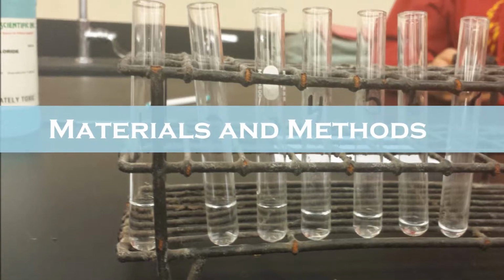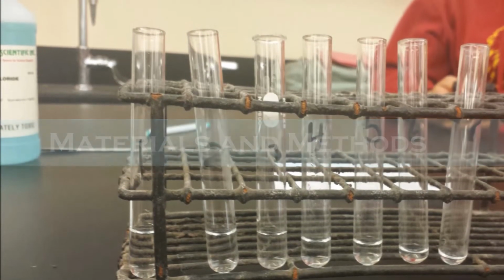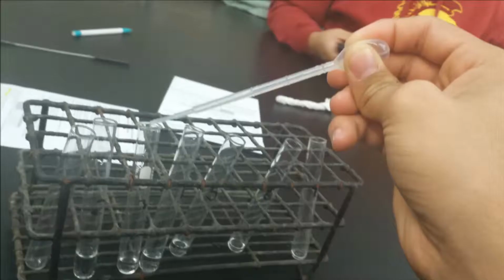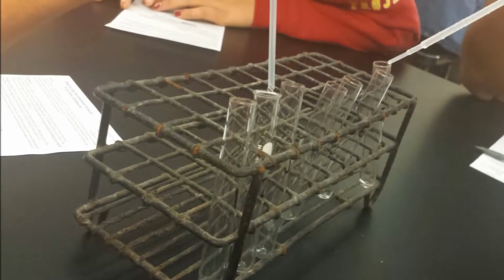To perform the lab, we use 7 test tubes on a test rack, 2 solutions, Na3PO4 and CuCl2, a pipette, a data table from the lab worksheet, and a stirring rod. Each test tube was numbered 1 through 7 and placed in a test tube rack. The pipette was filled with copper-2 chloride solution, and based on the specifications on the data table, a certain amount of drops were put into each test tube.